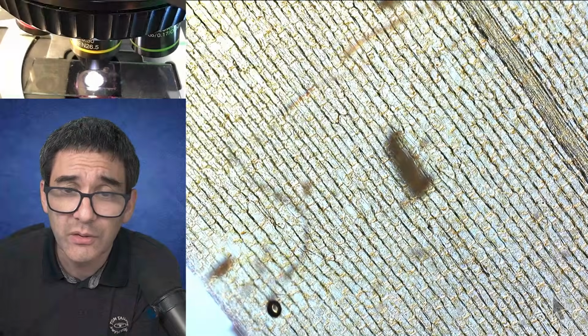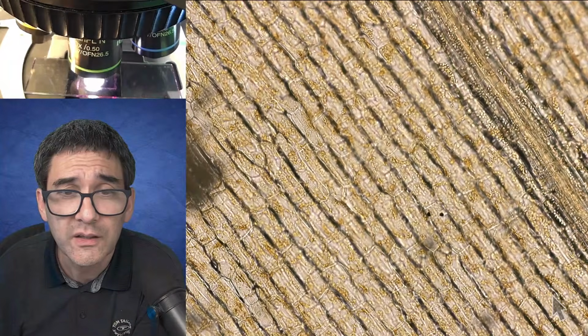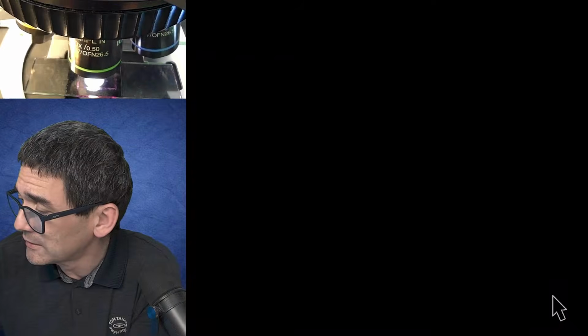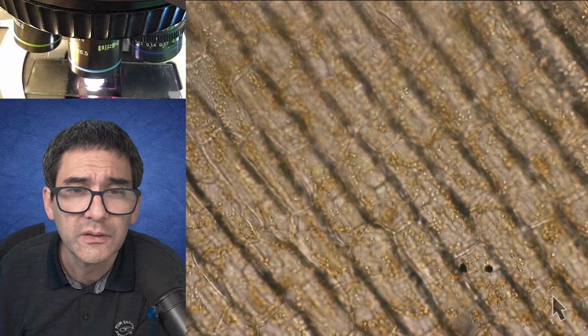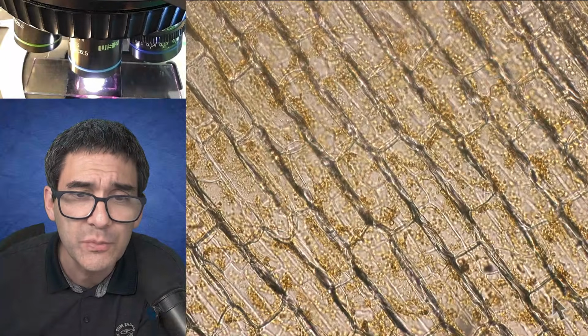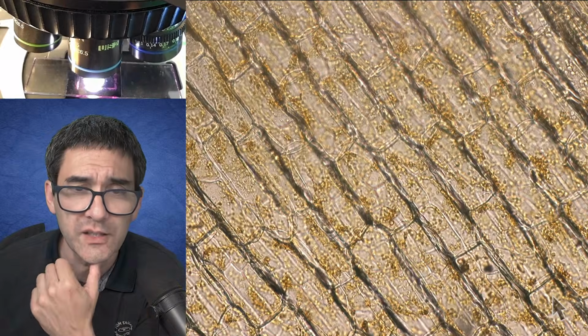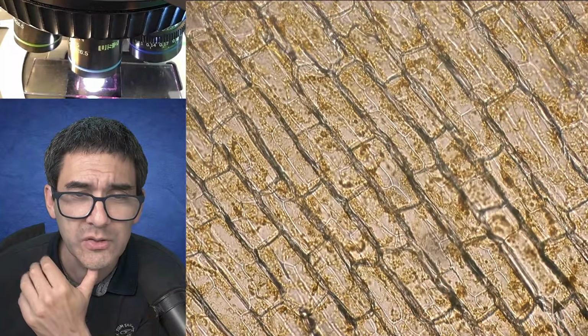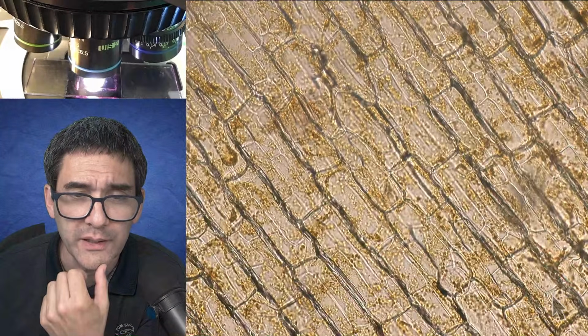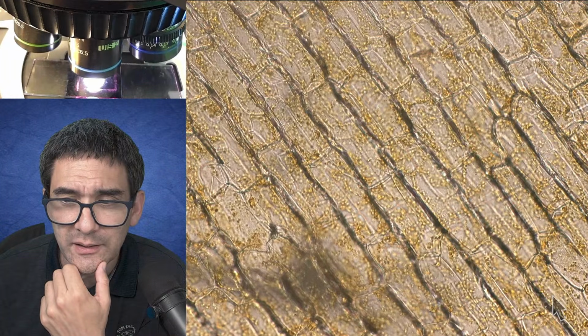The thing that you might notice is that, let's remove the DIC, it significantly lost in color. I mean, it's still a little bit green, but by far not as green as it used to be. It almost looks like the contents of the cells has shrunk a little bit, so it does not look quite as fresh and crisp anymore.